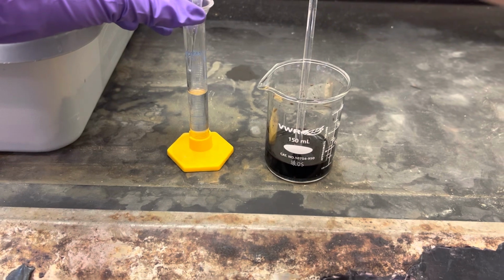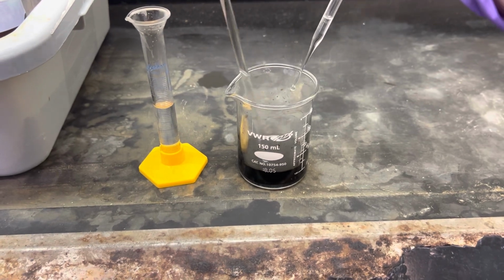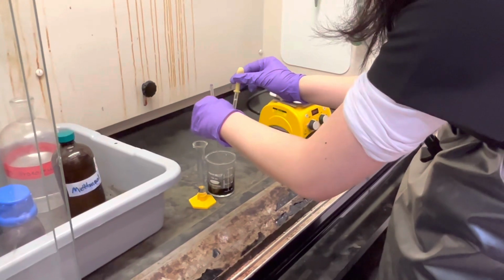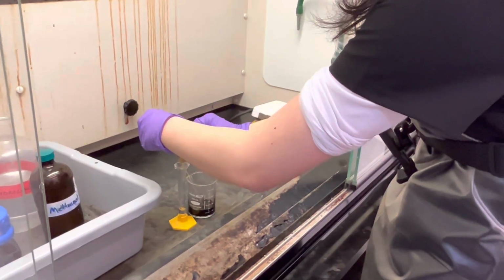In the fume hood, measure 7 milliliters of the hydrochloric acid and record the precise volume. Then slowly add to the beaker. Also, as a caution, make sure that the hydrochloric acid is only added in the fume hood. If the beaker needs to be taken out of the hood, make sure to cover it with a watch glass so the fumes won't escape.